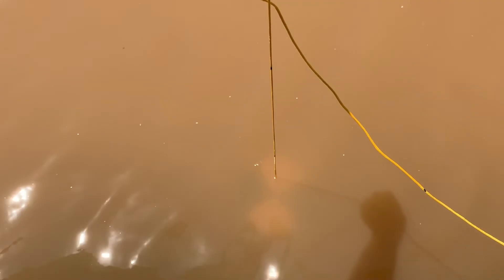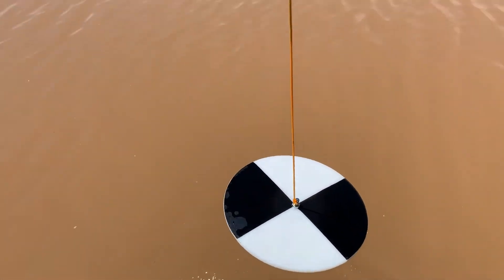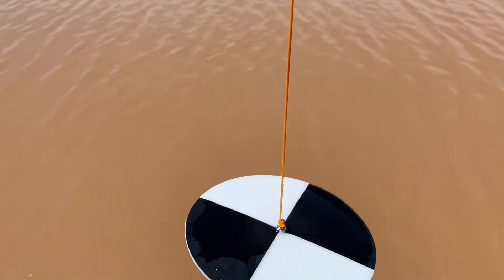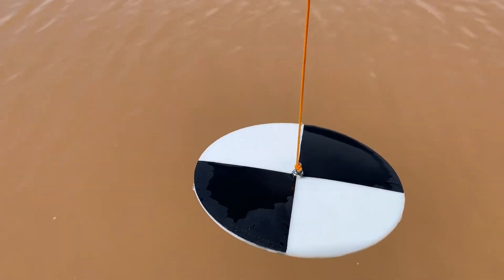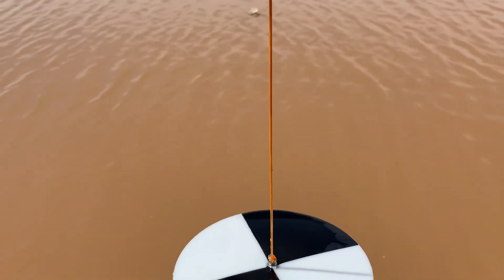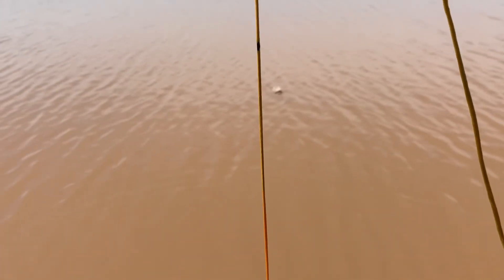I've exaggerated a little bit here so you can see the triangles well, but that would be your visibility depth. The second part is to pull the disc to the surface and measure that distance. I have my Secchi disc marked so that each black mark represents one foot — and in this case, we have less than a foot of visibility.